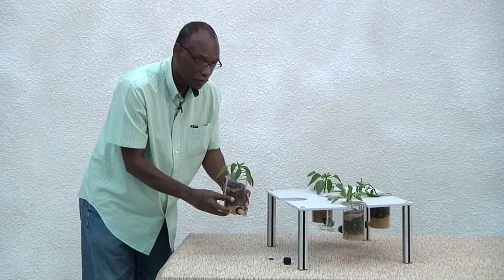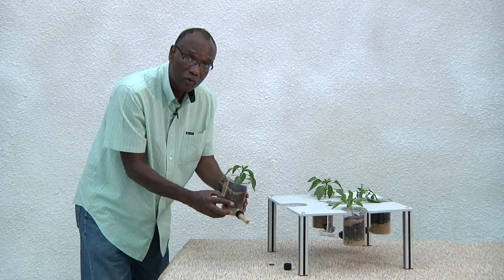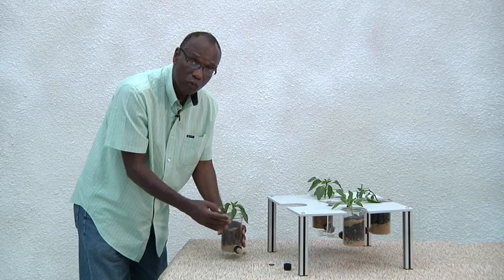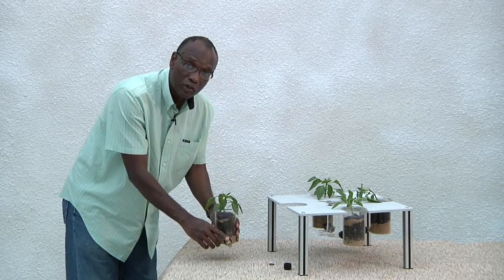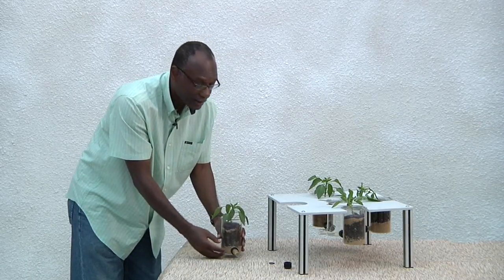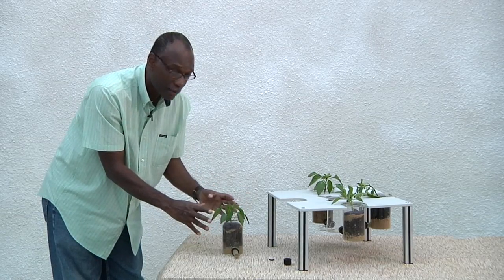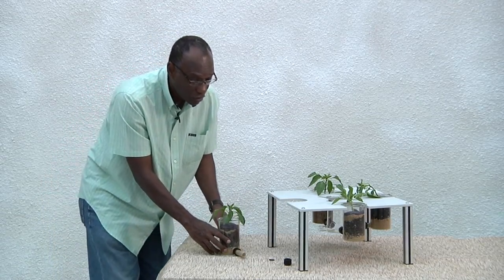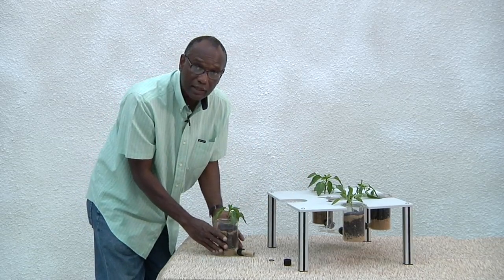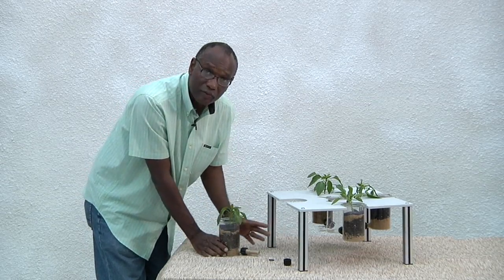Now this is the plant growth chamber. After the plant has been transplanted, you allow it to grow for about five to seven days for the roots to expand. You can water, and when you water, the nematode collection chamber serves as drainage — you can always collect the water from the end of it. Once this has been growing for about seven days and you're satisfied and have allowed for equilibration, you can now set up the entire apparatus by connecting the plant growth chamber with the nematode collection chamber to the rest of the olfactometer.